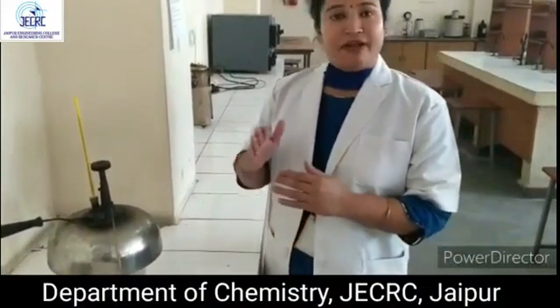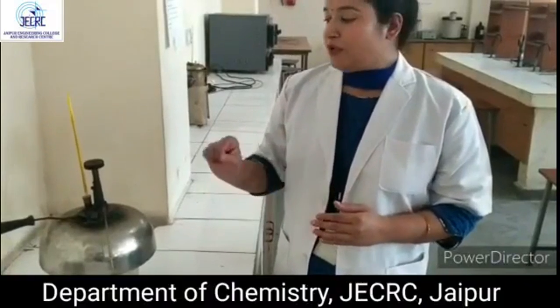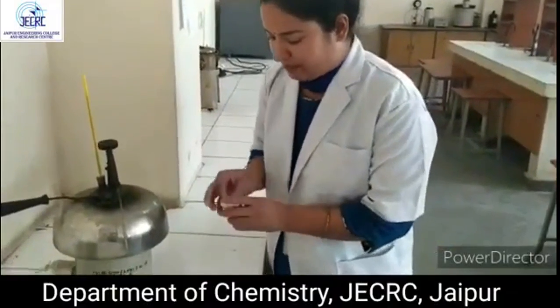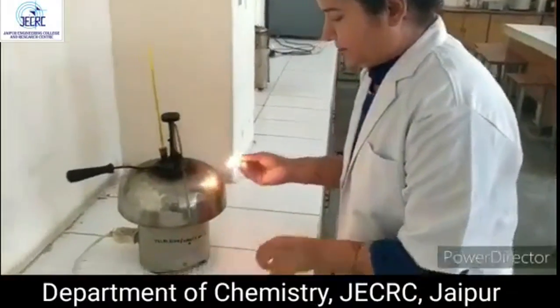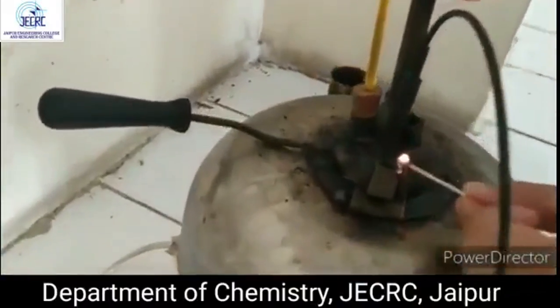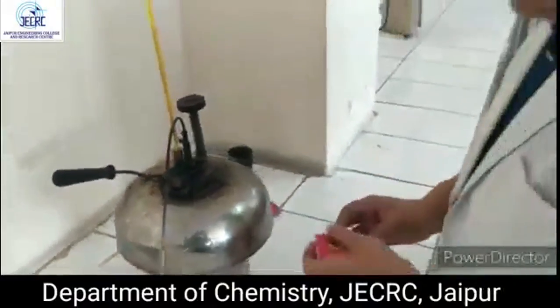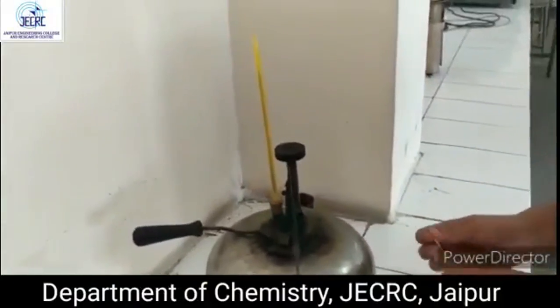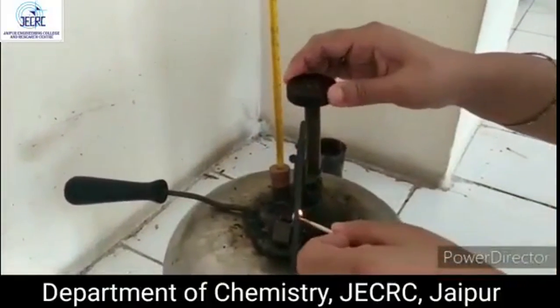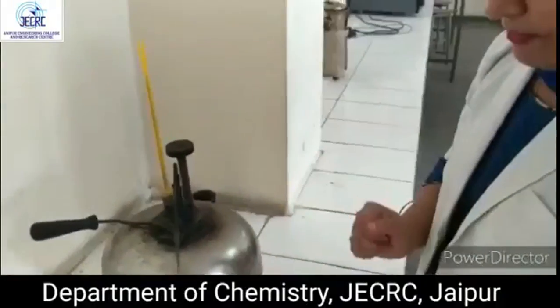Similarly, after the flash point appears, we have to find out the fire point. So we will continuously take the readings. For example, we are starting the experiment. We bring the matchstick near the pilot burner. Then nothing happens. It means we'll again repeat. After every 2 degrees, we have to measure the reading. See, the temperature increases continuously in the thermometer.